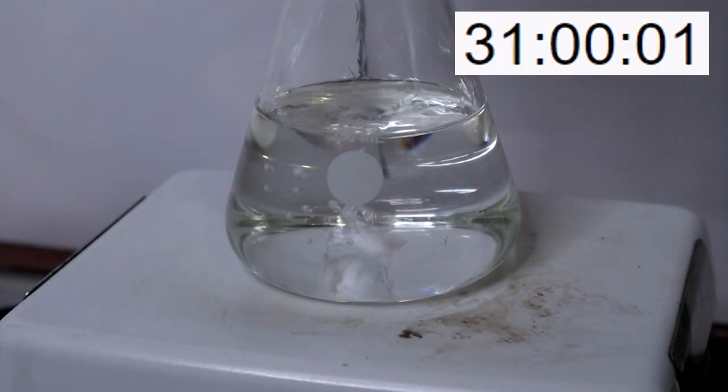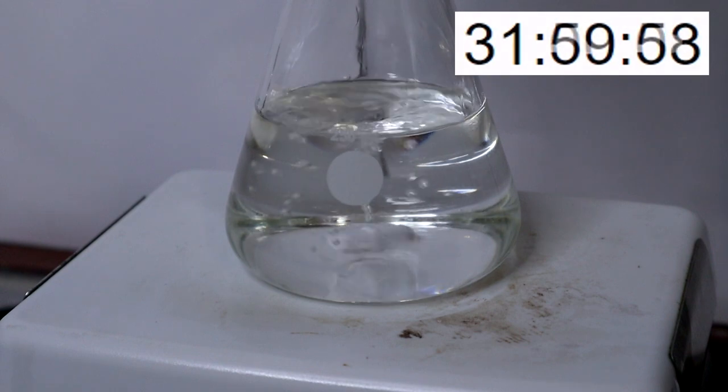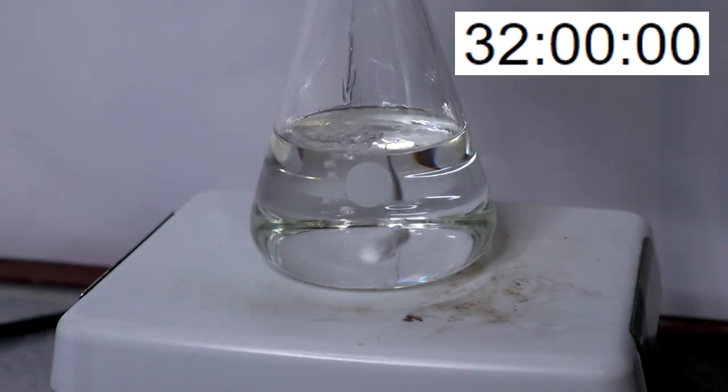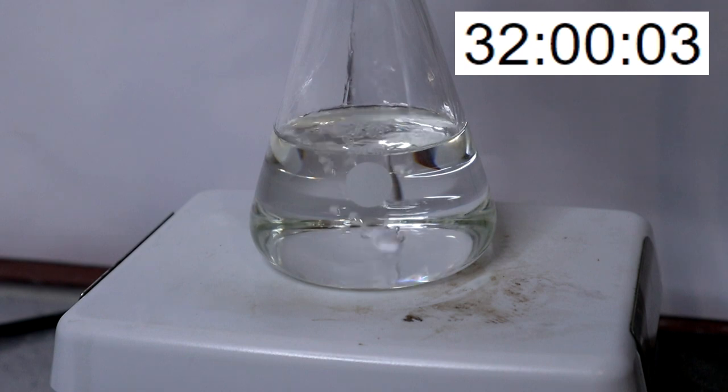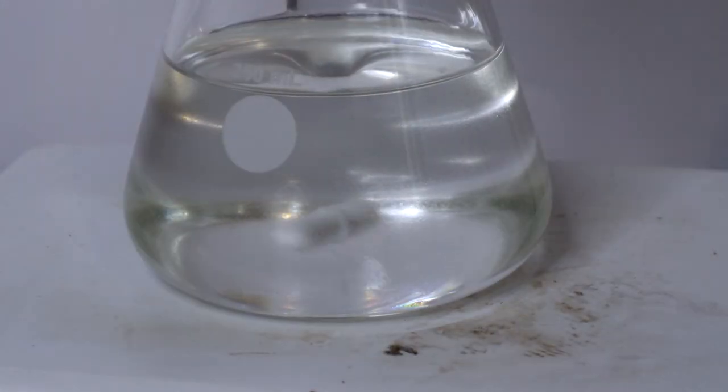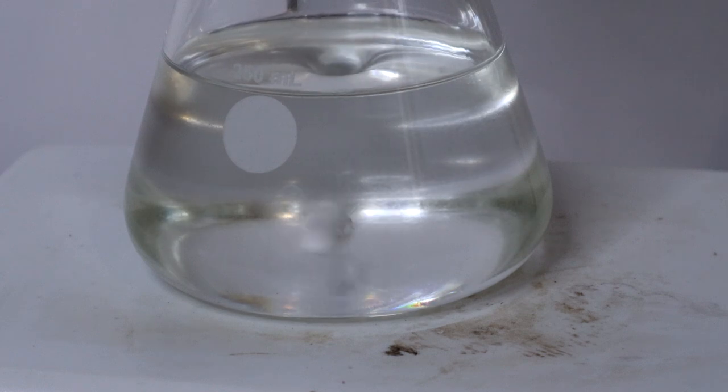This reaction takes a really long time. At the end of 32 hours, it looked like everything reacted, but once cooled back near to room temperature, the solution became cloudy once more due to the decreased solubility of nitromethane. Therefore, I decided to reflux the mixture for a grand total of 39 hours.